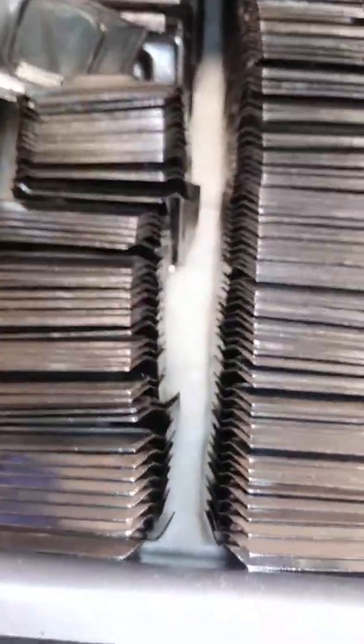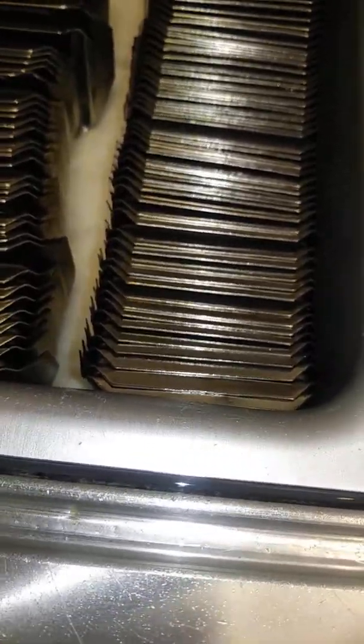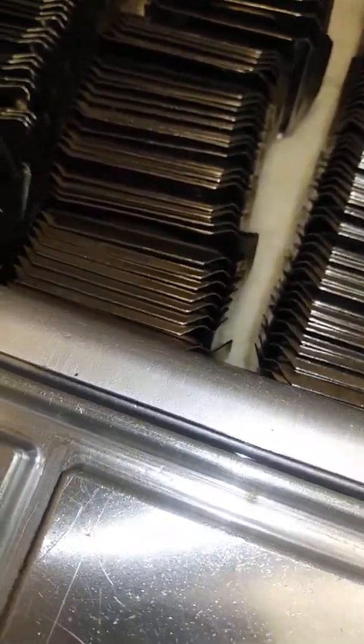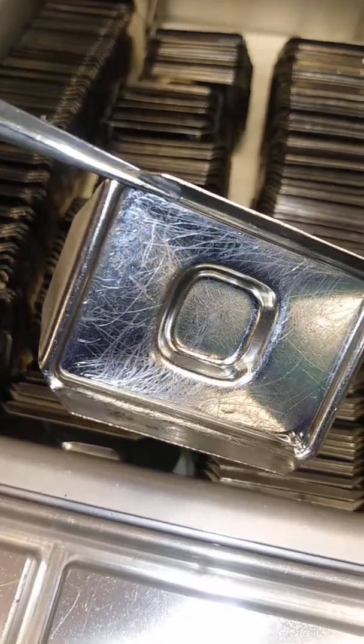These are the molds — we come here, we put the mold, and all the molds come in different sizes. You see this size, medium size. This one is on the largest side. We have biopsy molds also — this one here is what we call the biopsy mold because it's very small.